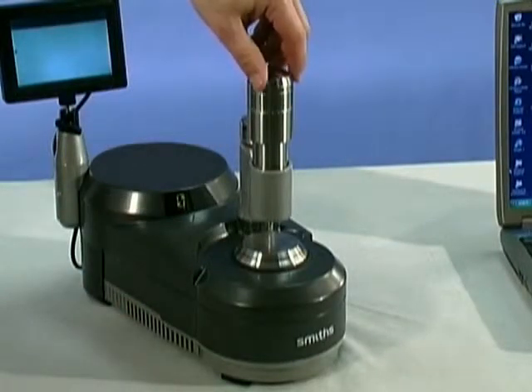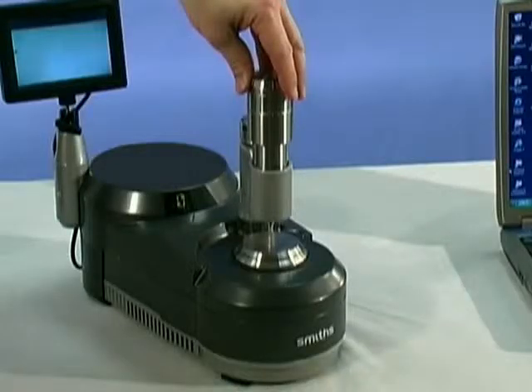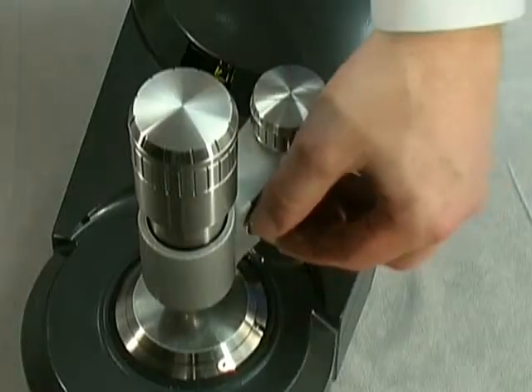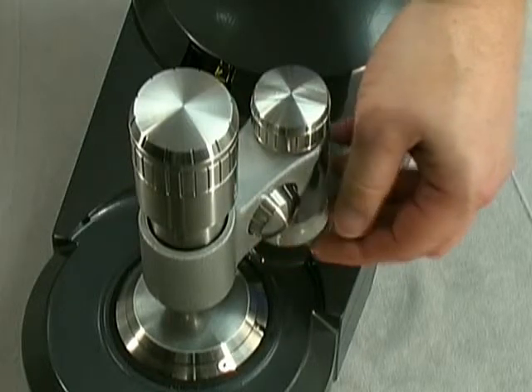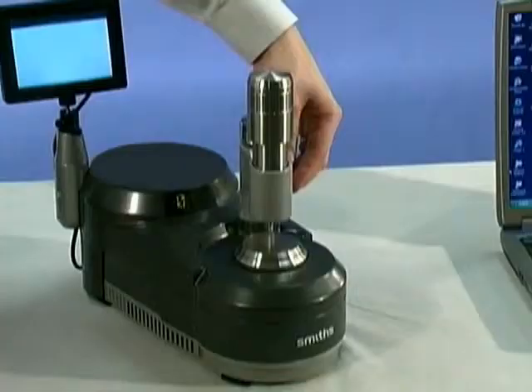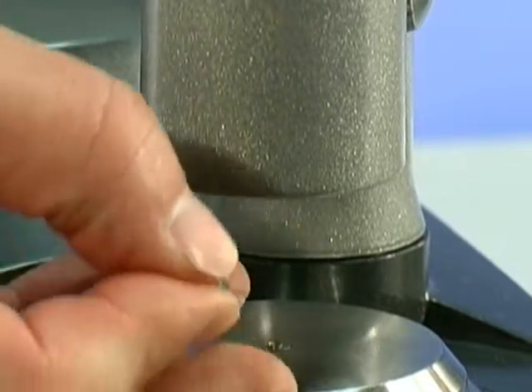This item is the sample press. One function is to press a solid sample tightly against the diamond interface so that we may get an appropriate IR signal from our sample. The second is that it provides bright field illumination for viewing samples placed over the diamond. The illumination is adjusted by turning the knob on the side of the system and is provided through the sample press tip.